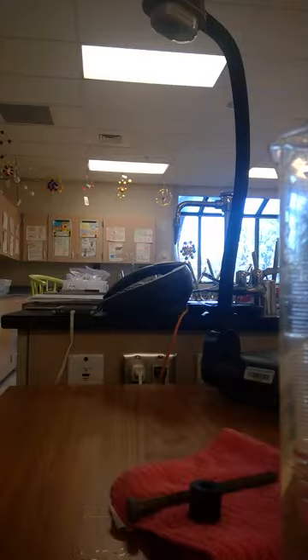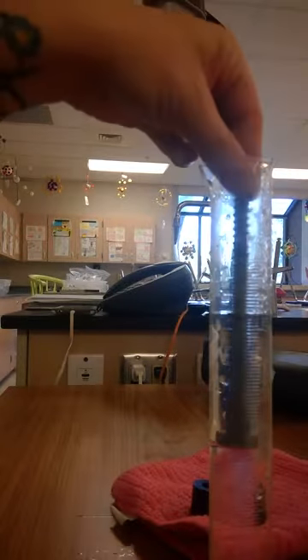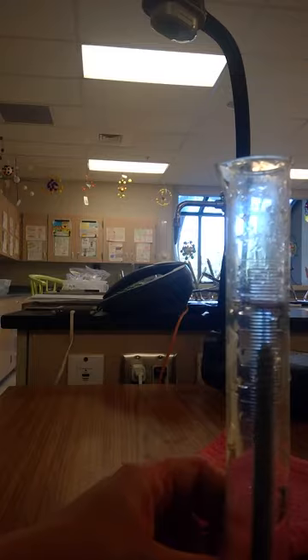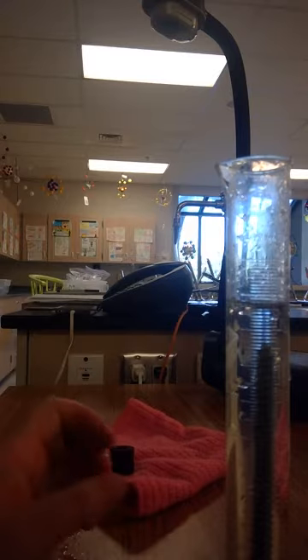Our next item, again, we have to have a starting volume. So we place some water into our graduated cylinder. And I have 80 milliliters in there. This time I'm going to place this bolt in there. So we start at 80 and we end at 88. So the difference there becomes the volume of the object only. And so if you do the math, you should have written down 8.